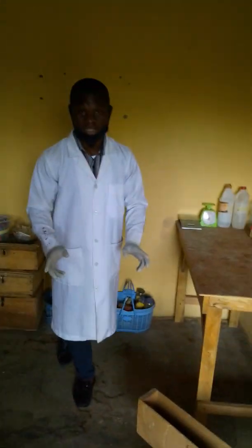I'm the research assistant in neurobehavioral. In this neurobehavioral lab, what do we basically do here? We administer our drugs, various types of drugs that we suspect or suggest could have neurobehavioral effects. We administer them to Wistar rats for our animals.